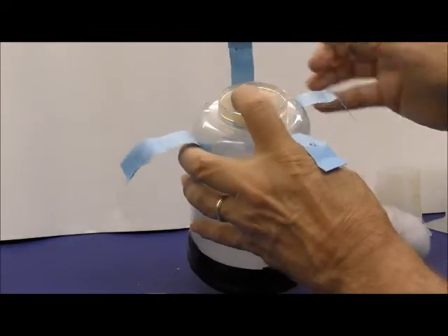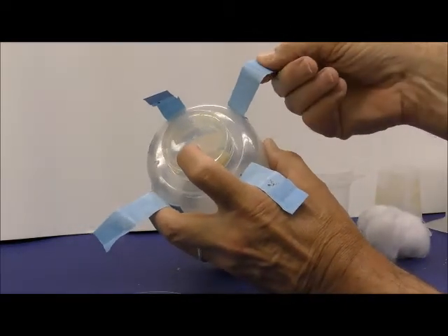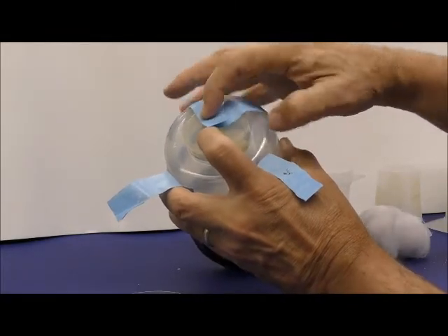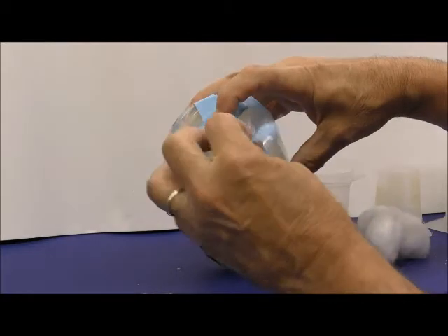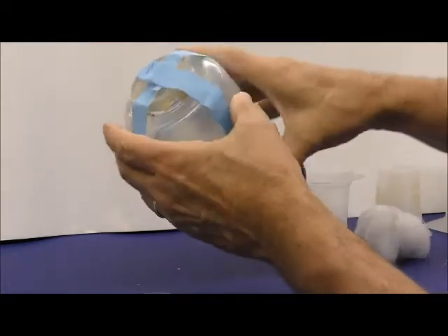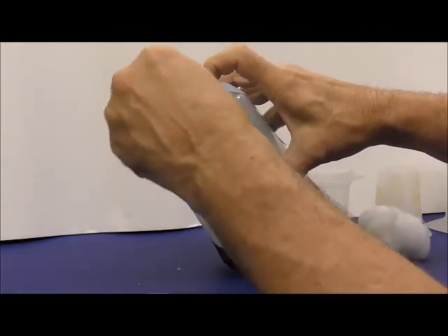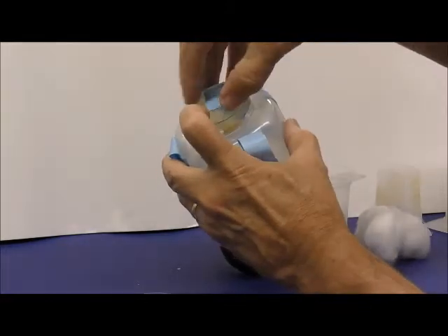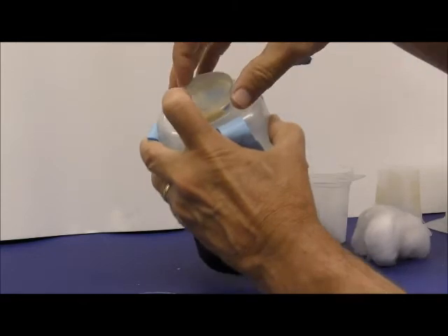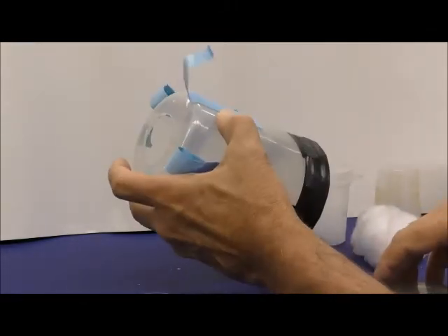And then you take the tape, and if you dog-ear the end of the tape, it's easier to have a little tab to pick up. So I dog-eared all of these, and now when I want to change it, I can shake down my flies gently, not to get all the food to drop off, take these little dog ears and pull those off relatively easily, switch out the plates, and put another plate on. So that makes it really easy.